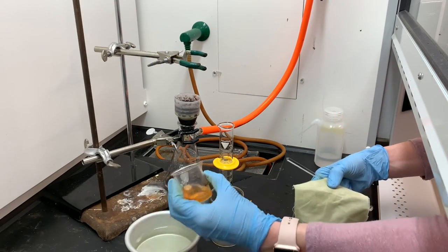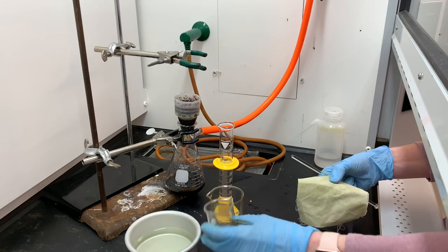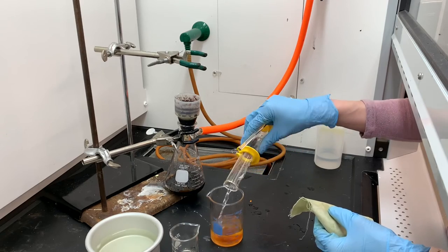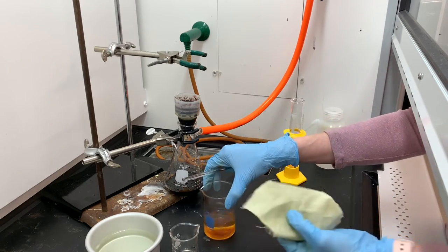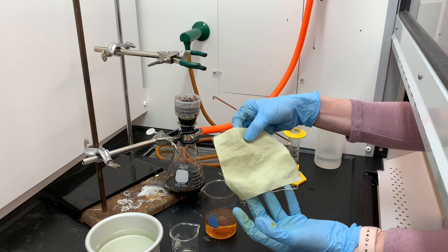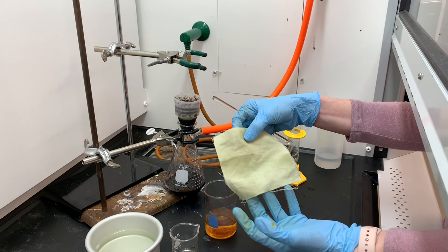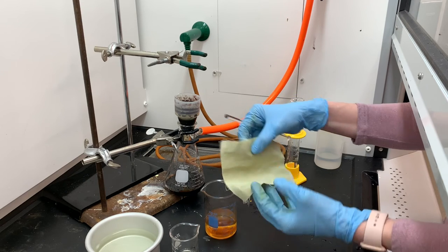The cloth is totally dry now and it's ready for the diazo component. I'm going to begin by diluting the diazo component in a little bit of water just to increase the volume and make it easier to soak the cloth. Remember the cloth has been completely saturated with the coupling component — it's embedded in the fibers of the cloth. So when I add the cloth to the diazo component, the coupling reaction is going to take place in the fibers of the cloth. The azo dye will be synthesized directly in the cloth. It's going to happen really fast, so watch closely.